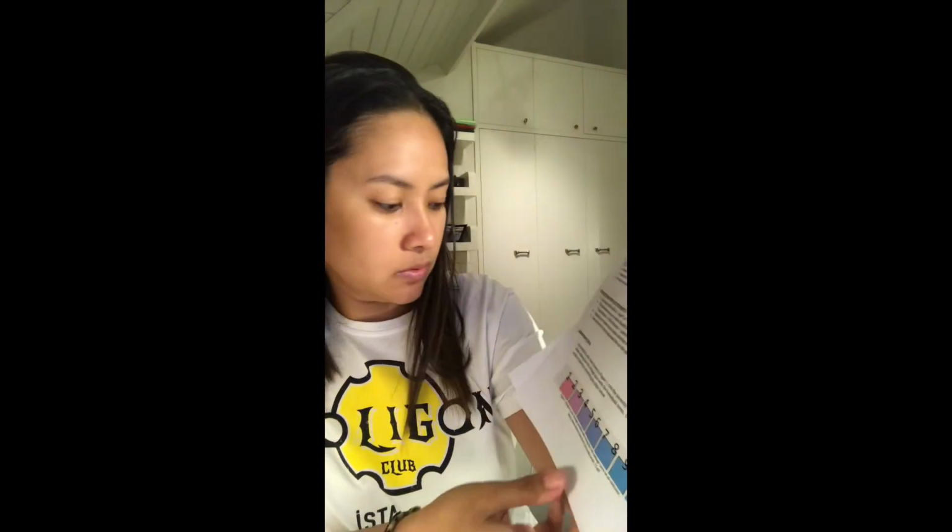On the laboratory quiz here, by using the color chart showing in figure 1, rate the intensity of the color change you observed when mixing the red cabbage juice with household items. Classify the household items as acids or base by completing the table below. Here is the list of the household items. This is to identify if the household item is acid, base, or neutral.